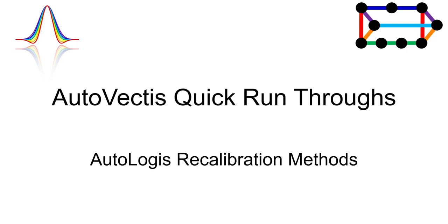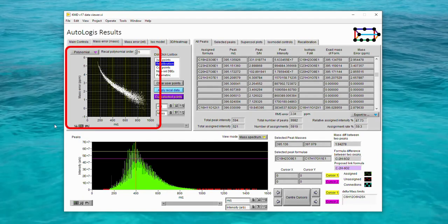Here we'll review some of the key recalibration methods available in AutoLogis. You can see in the results from this example dataset that the instrument calibration was a little bit off. And that's why the mass errors associated with the assignments are not centered on 0 and instead have this trend.